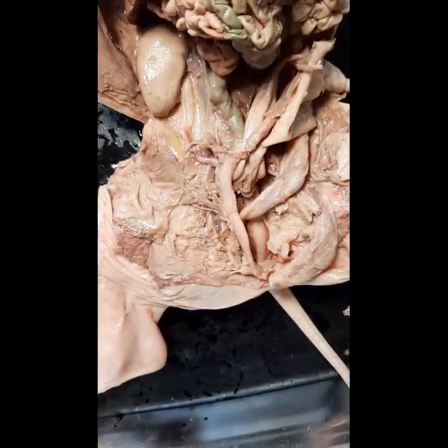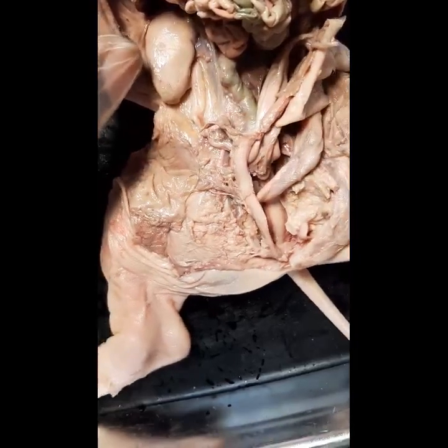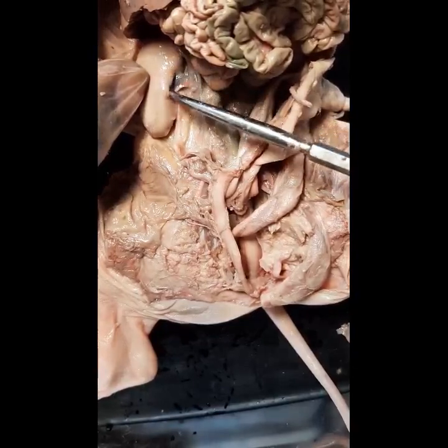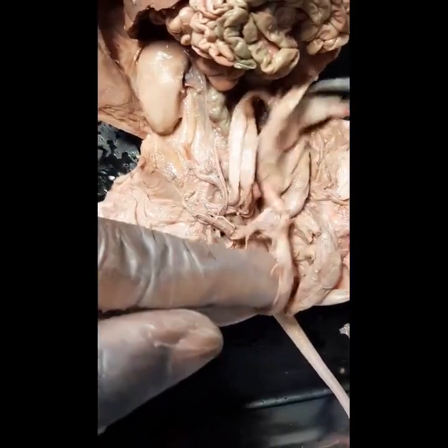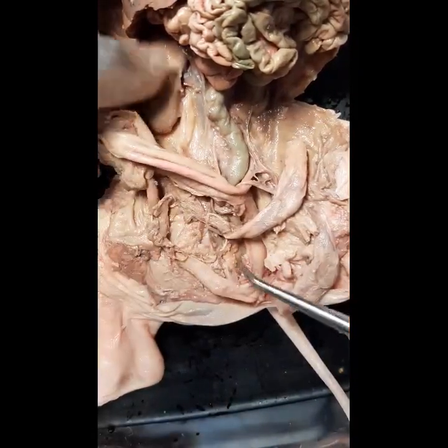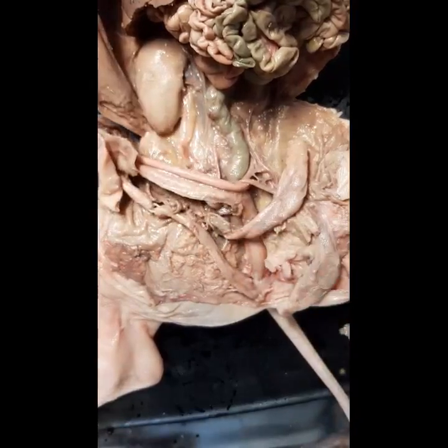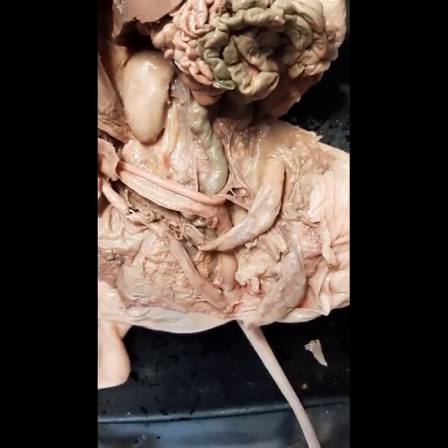This has been the urinary system of the male fetal pig. I will number these organs and structures for identification purposes. These are the structures and organs that we mentioned and looked at in the male fetal pig.